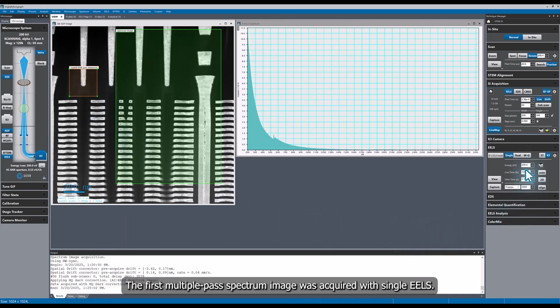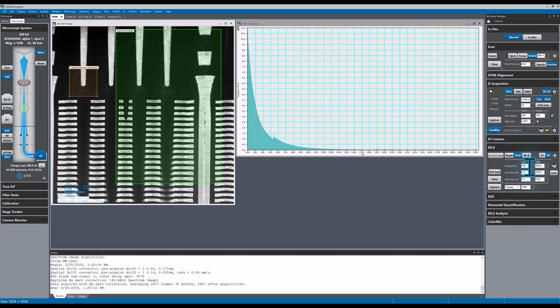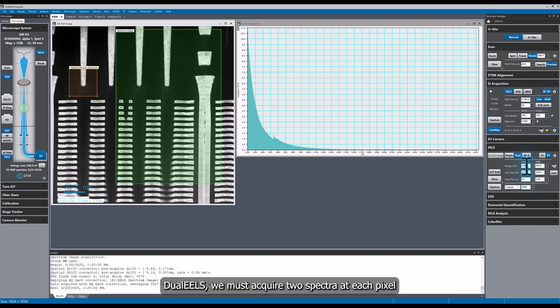The first multi-pass spectrum image was acquired with single EELS. The advantage of using single EELS is we can go much faster since we are only acquiring one spectral range at a time. With dual EELS, we must acquire 2 spectra at each pixel, one low loss and one high loss spectrum. However, now we can deconvolute thickness effects and we can use the ZLP lock feature.